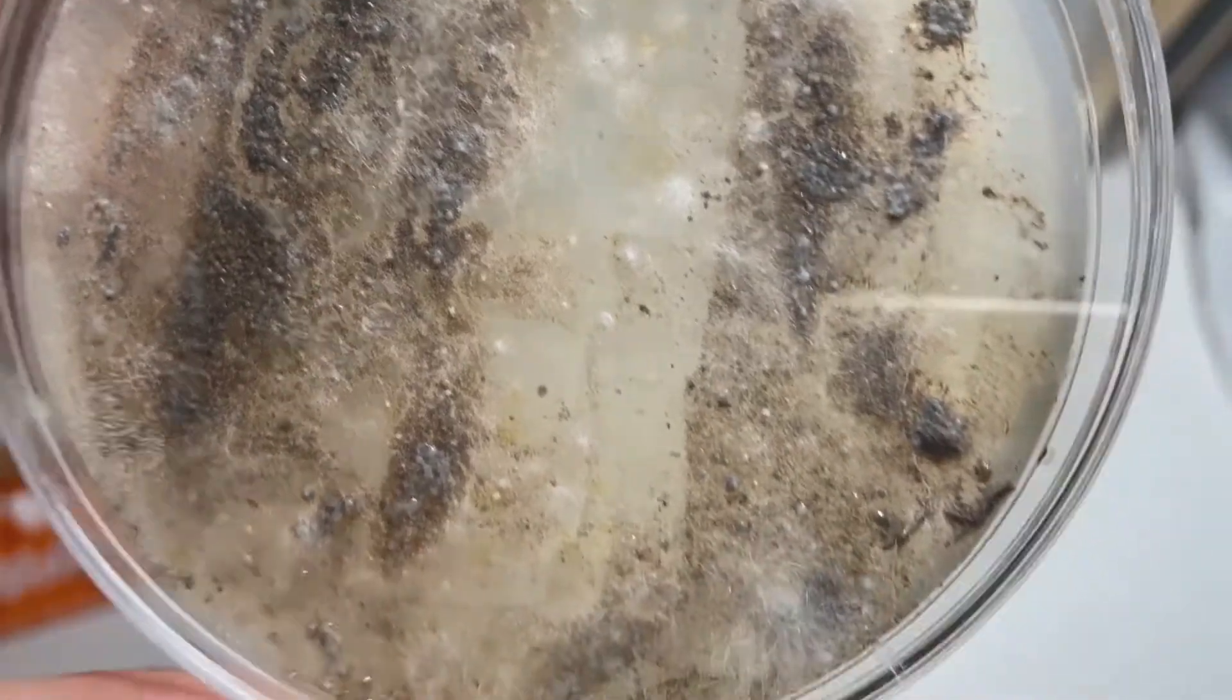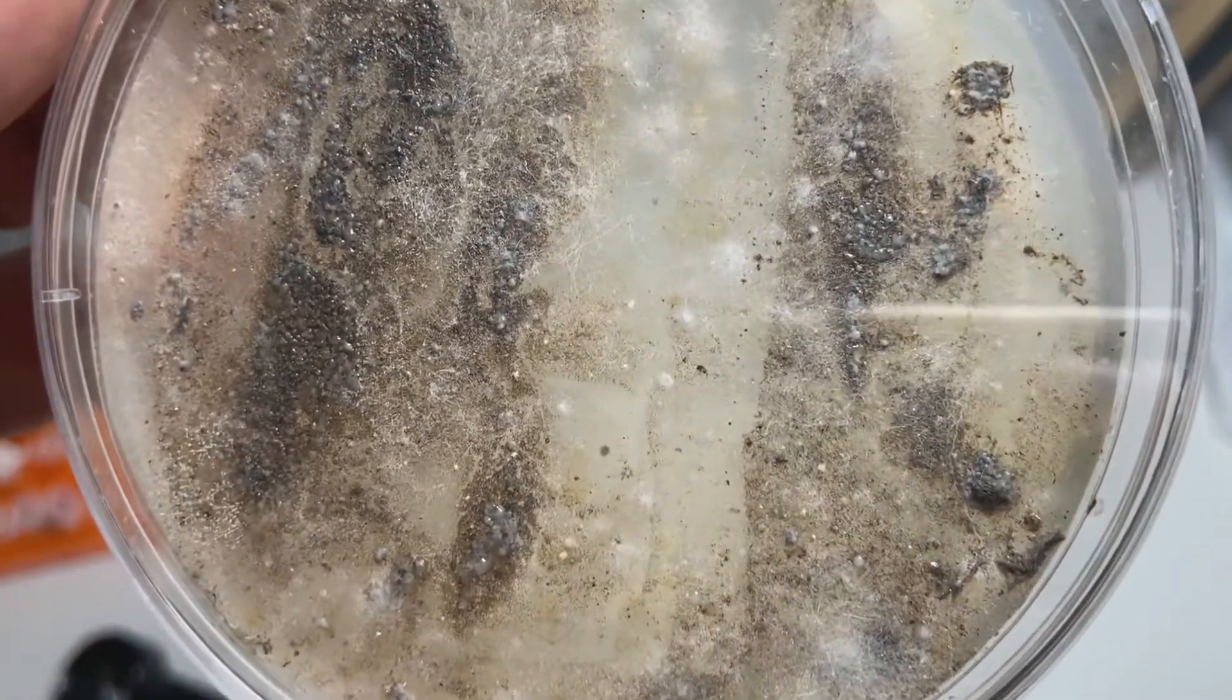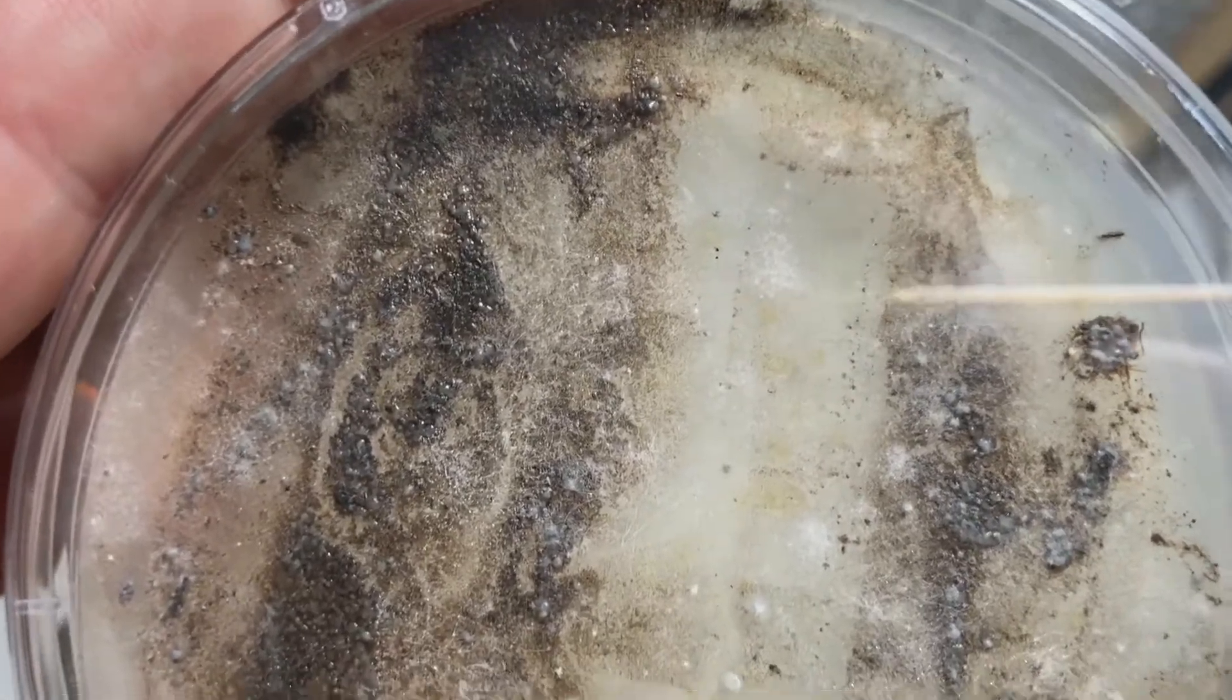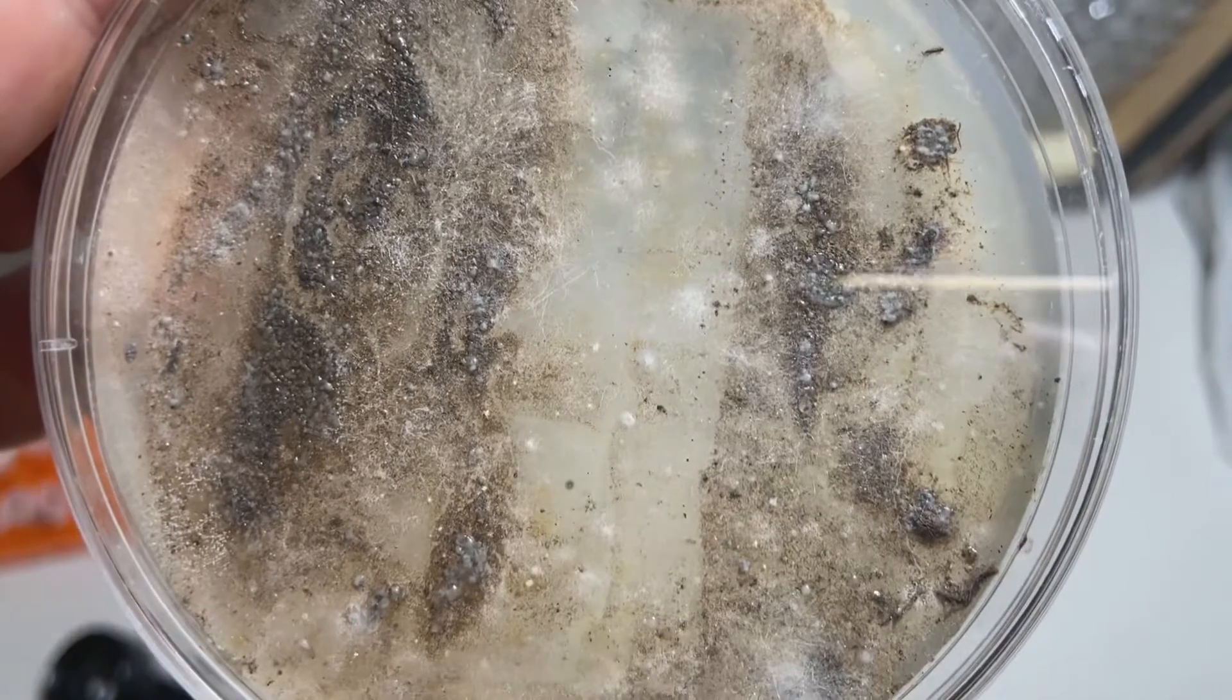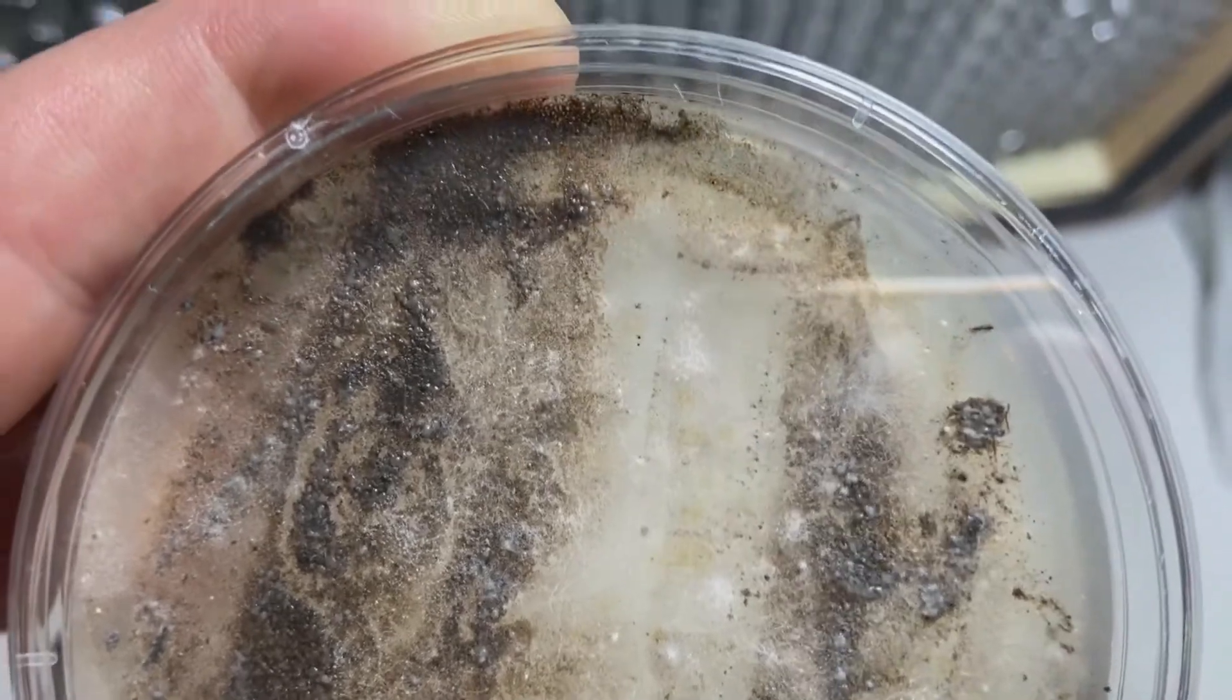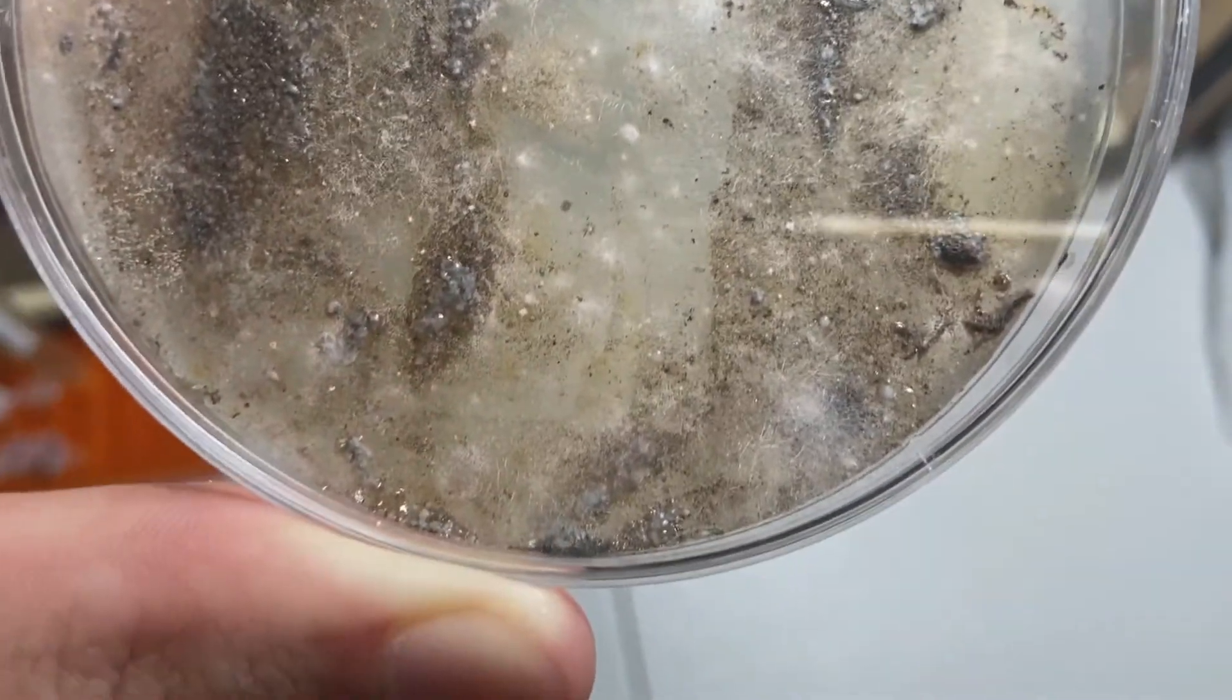I think what I'll probably do is a 10x or maybe even a 50x dilution. You remember I used a full dilution for this plate, and I want to see if I can get more spacing between the fungal colonies so I can do a better job of isolating them onto their own plates.